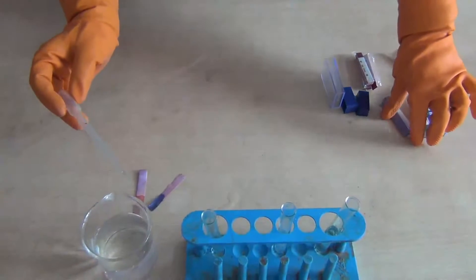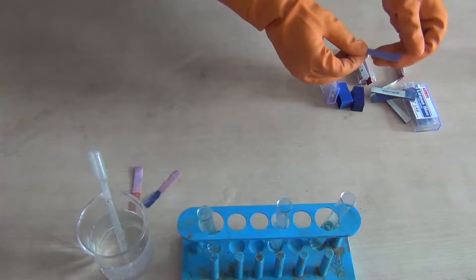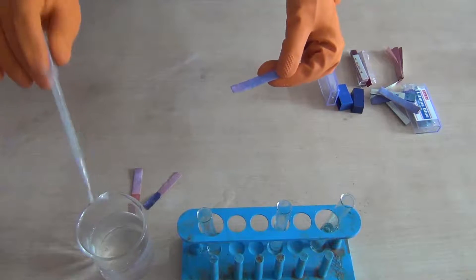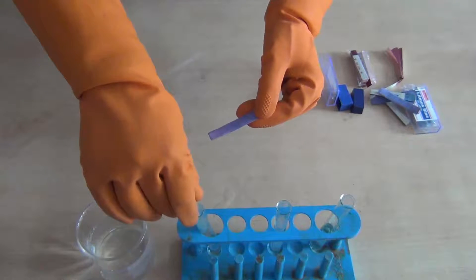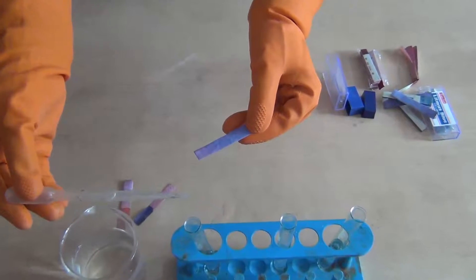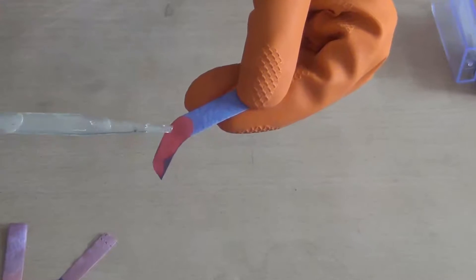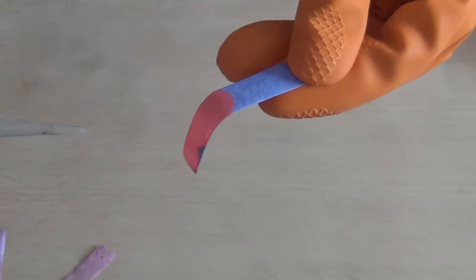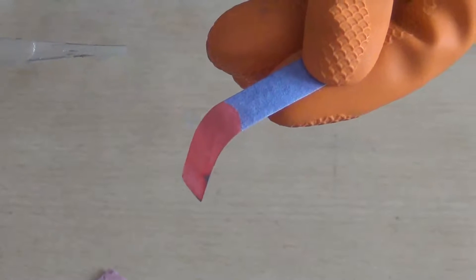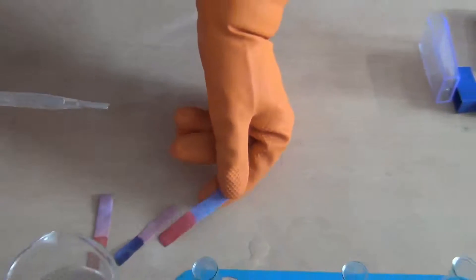In the same way, take another leaf of blue litmus paper and take some amount of solution from test tube C and pour some drops of the solution on the blue litmus paper. You can see the color of the blue litmus paper has changed to red. So the solution in test tube C is acidic in nature.